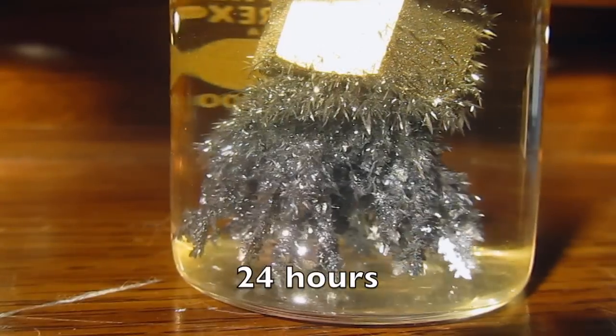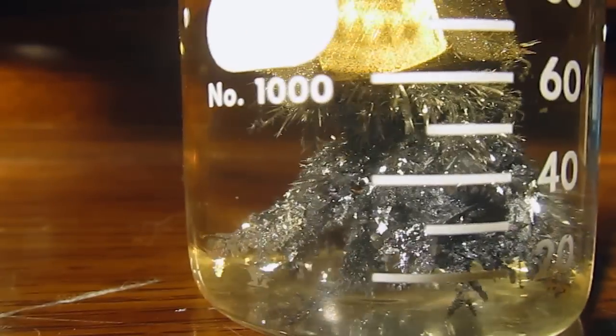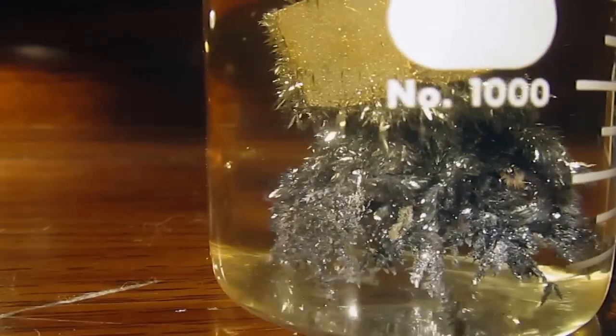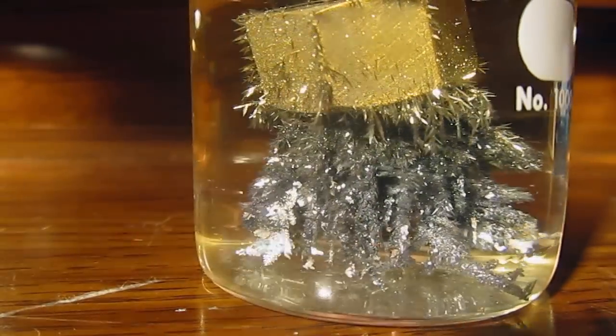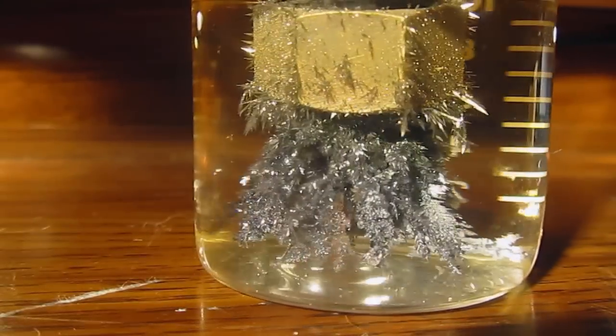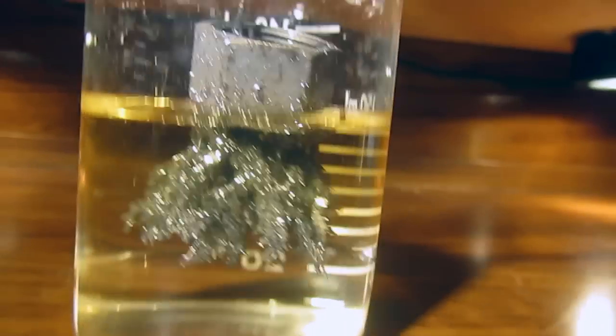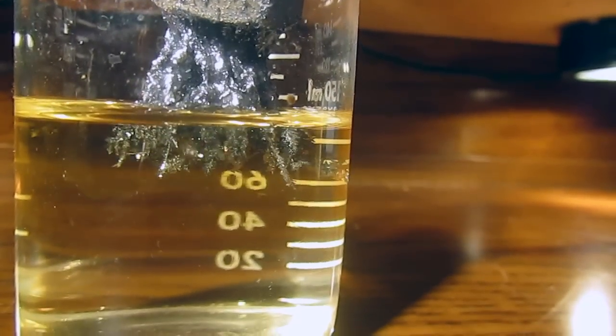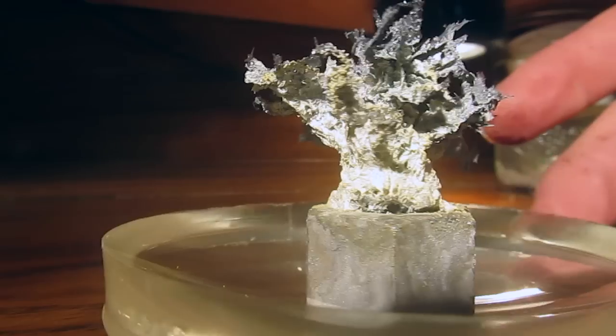24 hours later, my tree is well developed and has lots of big, bright crystals on it, but the problem is they're kind of weak and fragile. You can see them swaying in the water. I tried to take the tree out of water to preserve it and save it, but when I did that, all of the leaves melted down and it was hard to retain its original shape as you see here.